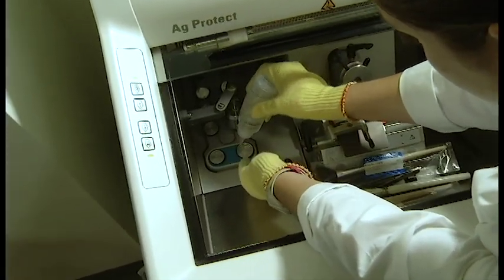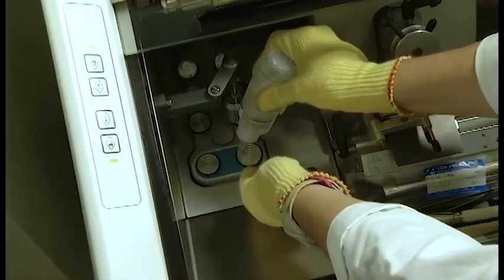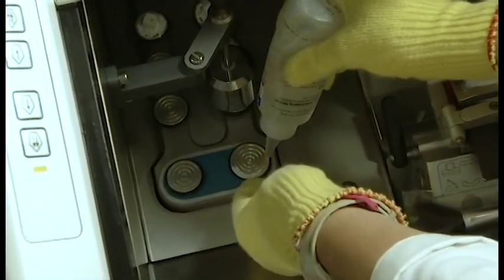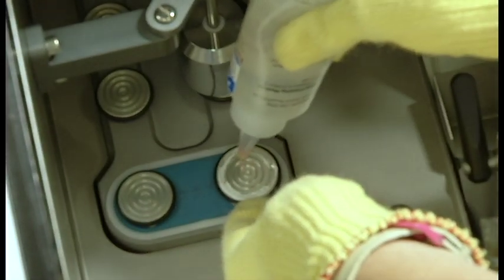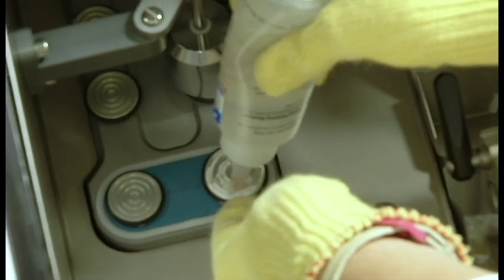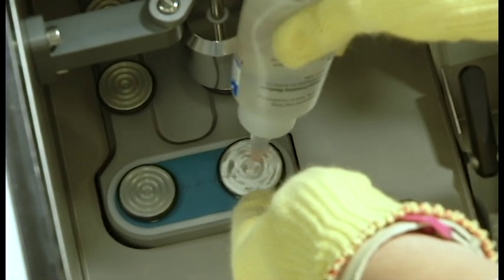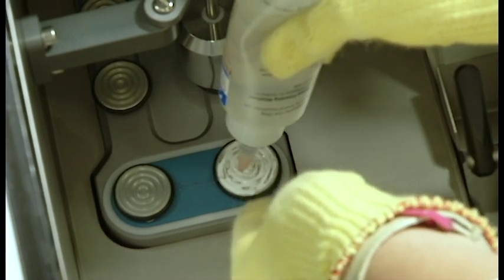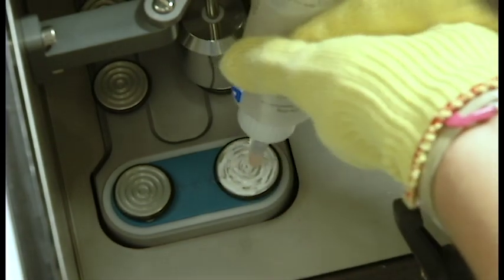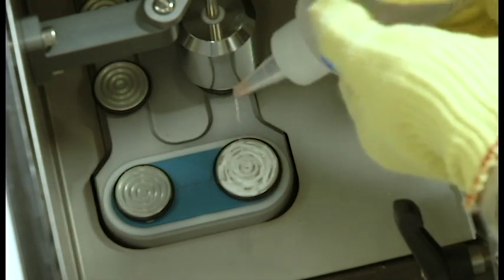The next method of mounting a tissue is done directly on the specimen disc. To begin, you're going to create a base using the media and applying it directly to the specimen disc. You're going to see that it immediately begins freezing and that's okay. All you need to do is make sure that there is a small area in the center of the media that is not frozen where you can place your tissue inside.